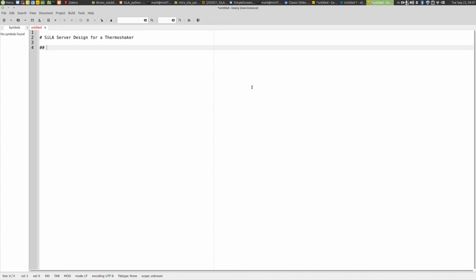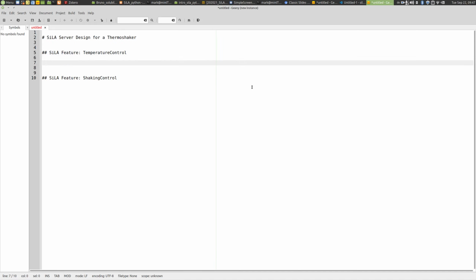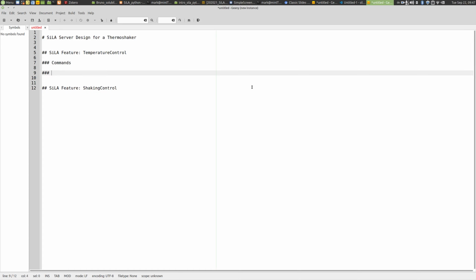So let's say it has a temperature control. So SiLA feature temperature control, and a second feature should be the SiLA feature, the shaking control. So each of these features consists, as I tried to explain, of commands and properties.